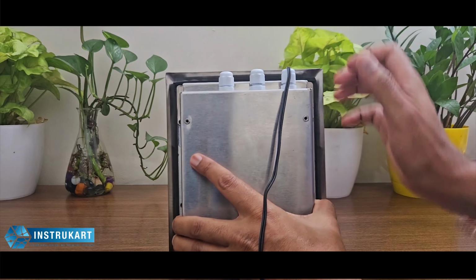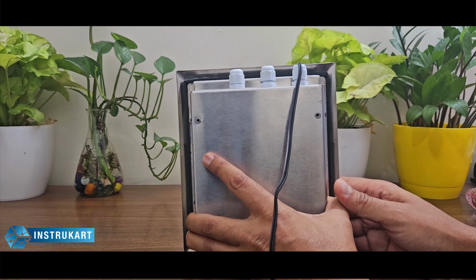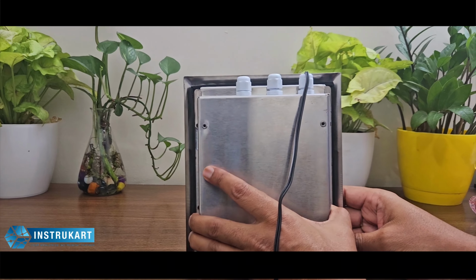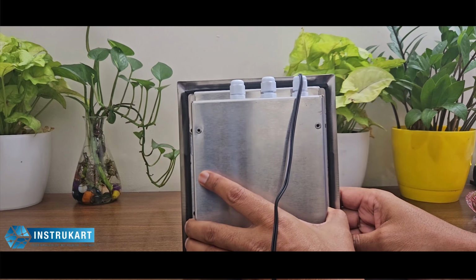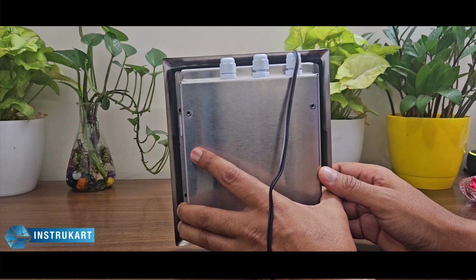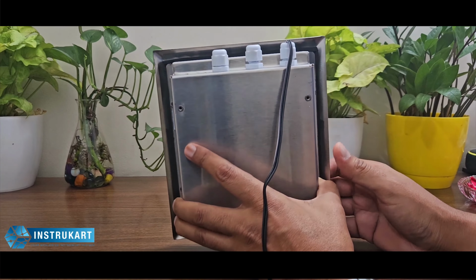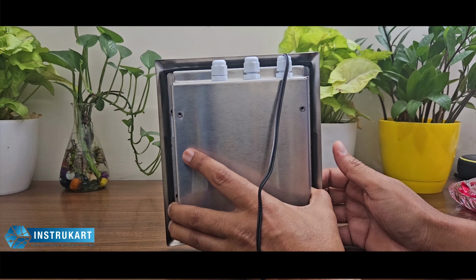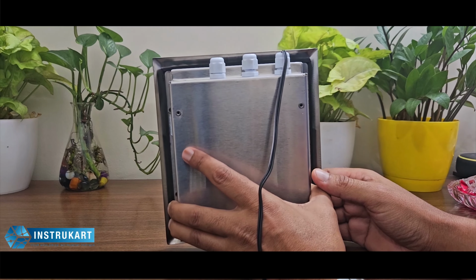We have the glands for the communications also. Input is 24 volts DC. However, it can be used in any country since the adapter which is provided is between 110 volts to 230 volts, 50 to 60 hertz. We also got analog output which is 4 to 20 milliamps, and it has got isolated RS485 Modbus communication as optional. It can also be connected through Ethernet, TCP/IP on customized orders, and it is an IoT ready device.